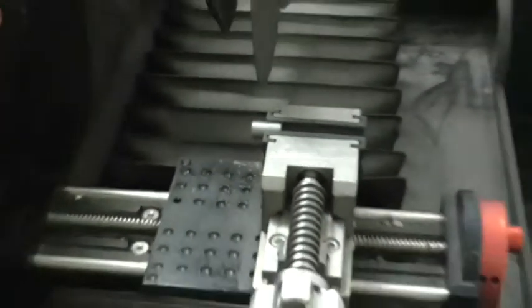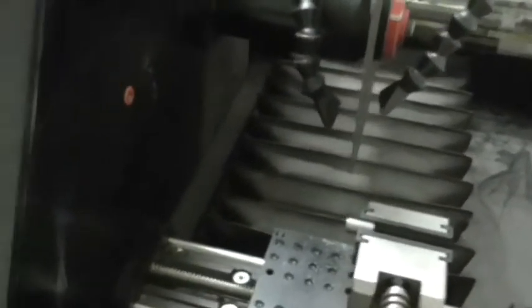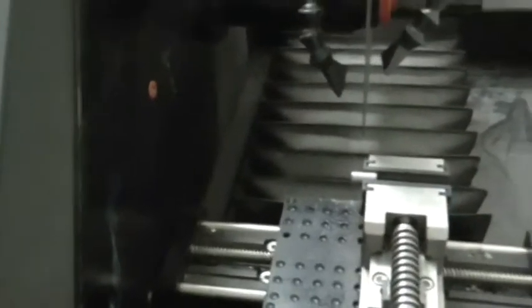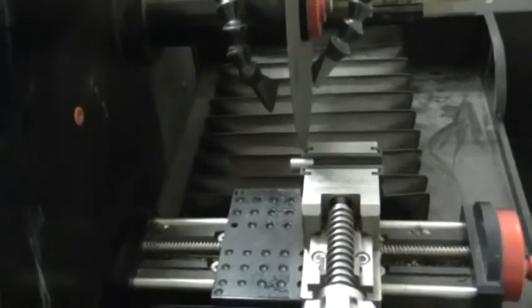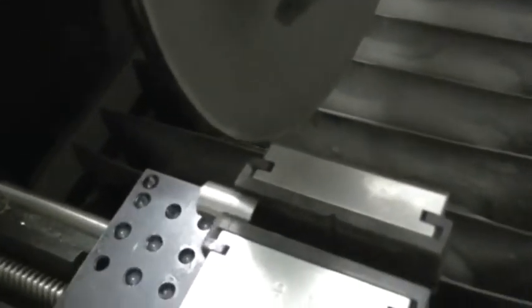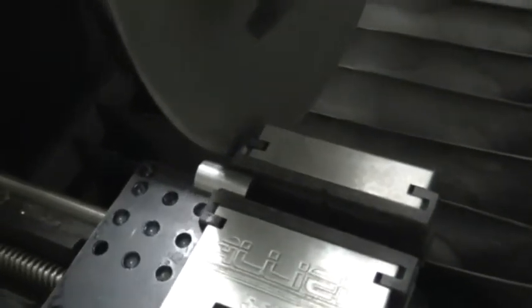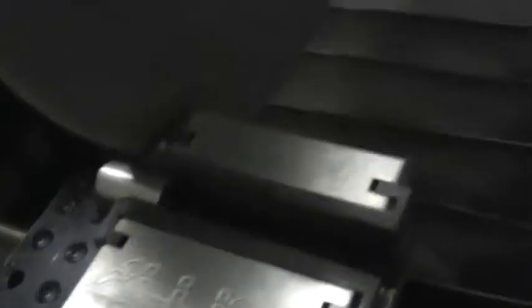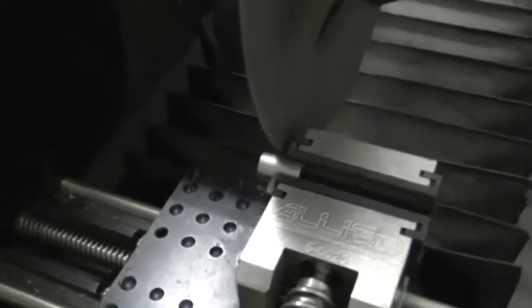As you can see, it's moving towards the blade. If we press reverse, it moves it away. What we're going to do now is adjust this so that the specimen is close enough to the blade — approximately an eighth of an inch away — so that it provides some clearance when the blade starts moving.